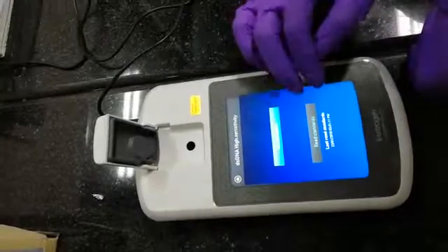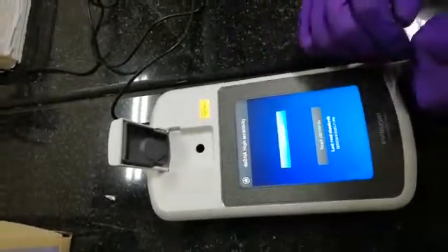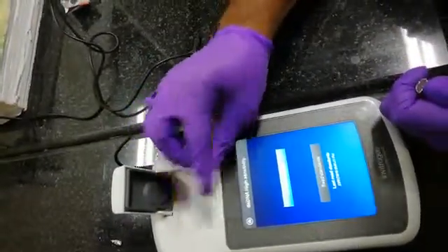For our sample we have used the double-stranded high sensitivity kit, so press that. There are two options: run samples and read standards. We have already taken the standard values yesterday, so we are directly going to run the sample. You take the sample, put it in the fluorometer, and select run sample.